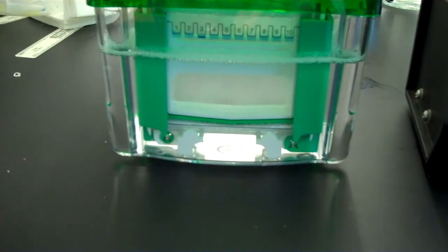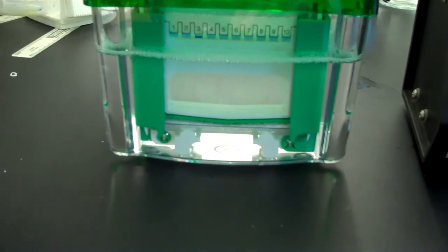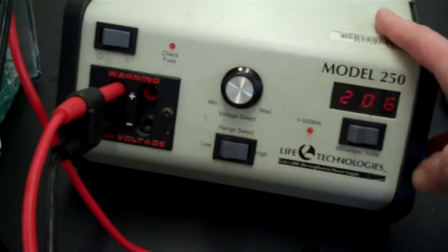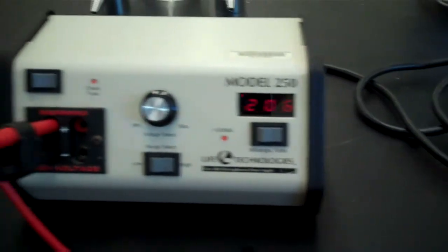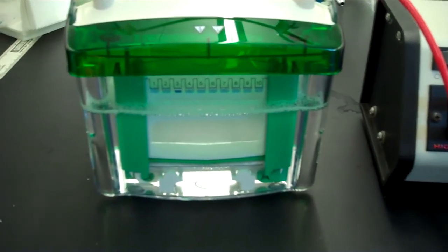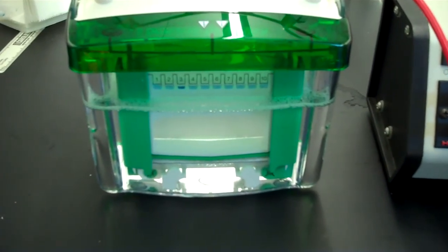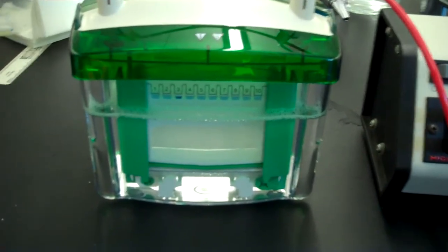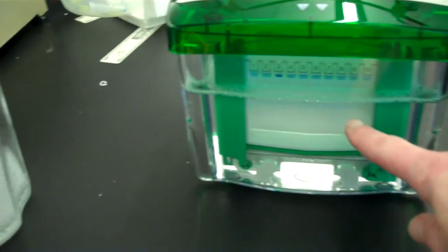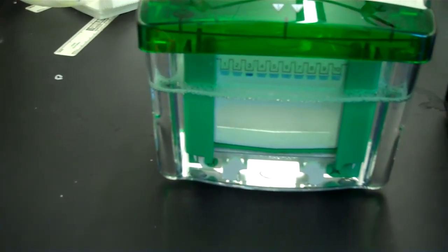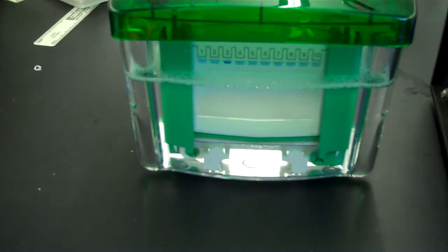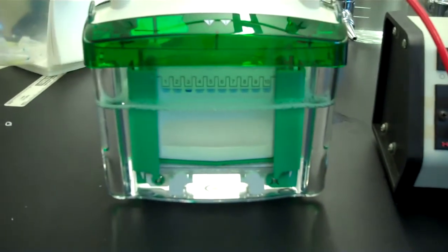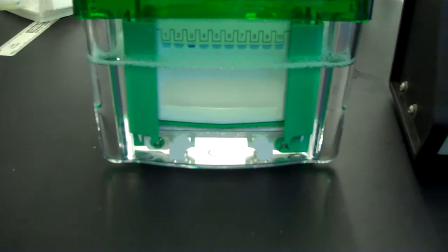And if the liquid amount goes beneath that short plate on the inner chamber, it will short out the circuit and you will no longer have any electrophoresis. When that happens, you won't see any bubbles here. And if you go to the power supply and you go to milliamps, rather than reading a number, it will read zero. So if this happens, please get your instructor and you will add buffer and get your electrophoresis proceeding again. So you will run this for about 30 to 45 minutes and you will then see the tracking dye begin to go down. Remember that like agarose gel electrophoresis, it is going to separate out the proteins in this case according to size. Now, the proteins will be invisible. You have to stain to see the proteins. However, you will see proteins on the lane that contains your standards because they are pre-stained.